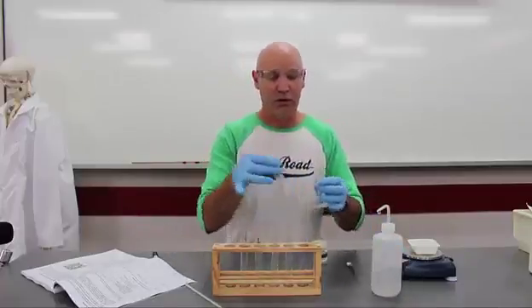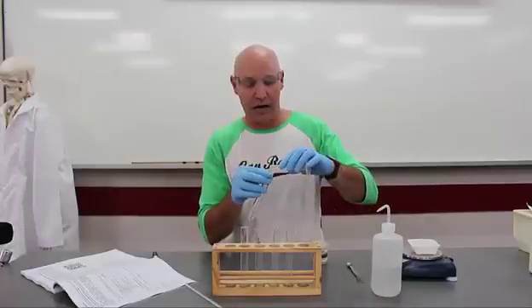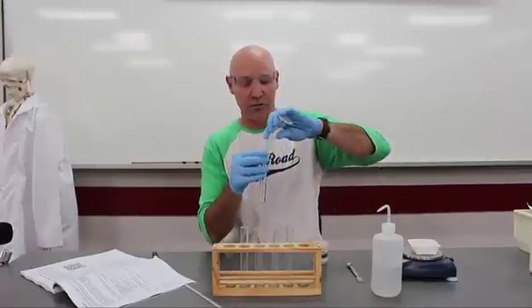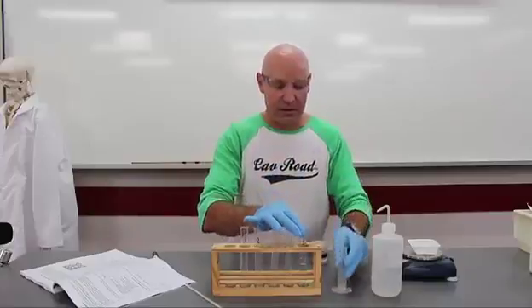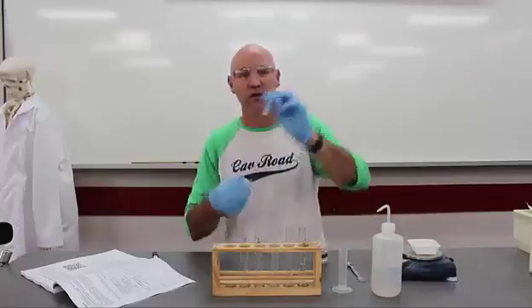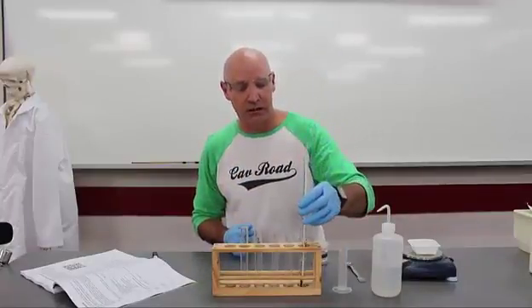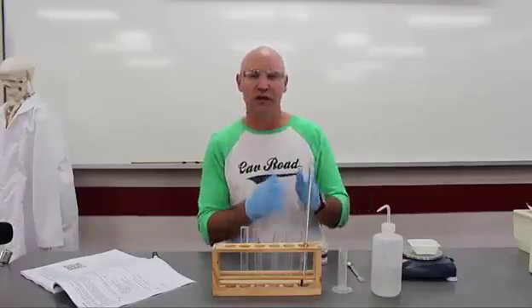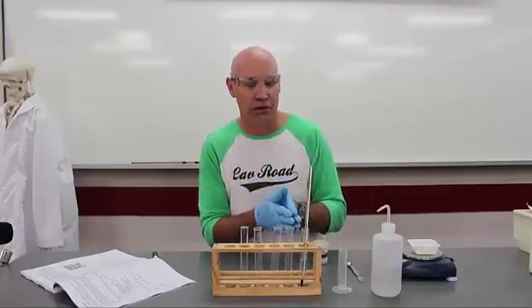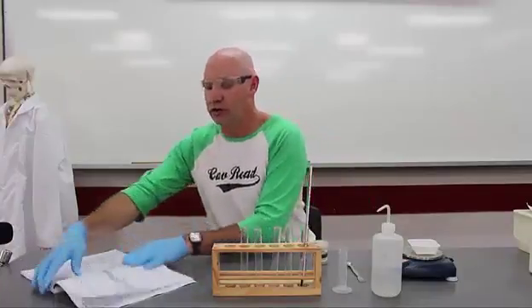Okay, I'm going to use the test tube 5 because that's for 5 grams. Make sure we've got all of that water in there. The amount of water is the same for every reaction. We're then going to use a thermometer. Put that in just to measure the temperature of the water. That's our starting point. Once you've got that measured, you're going to record that on your table.